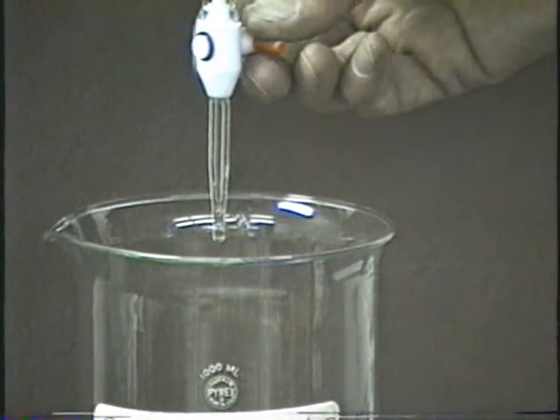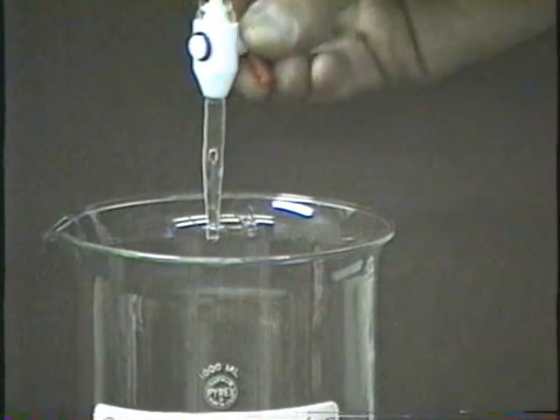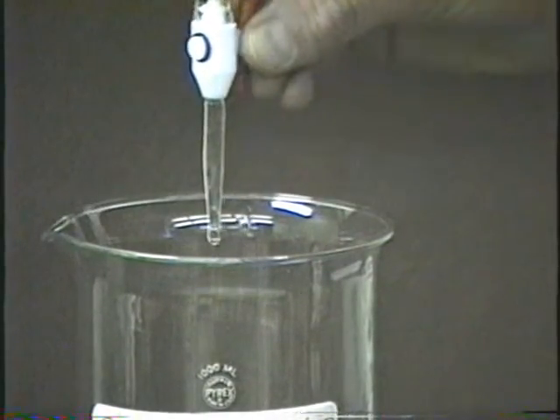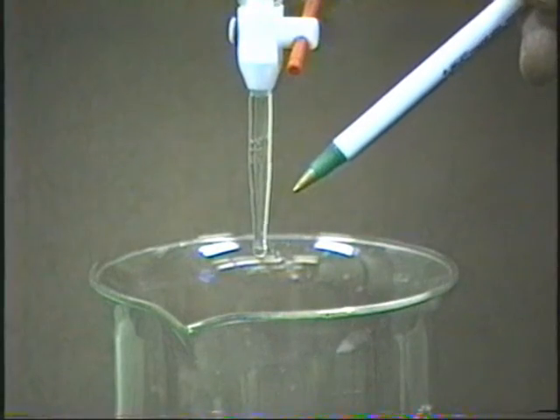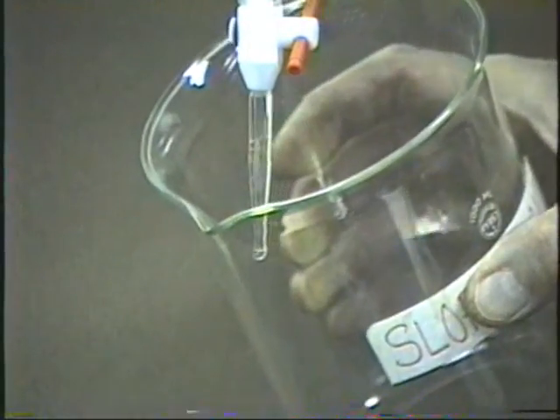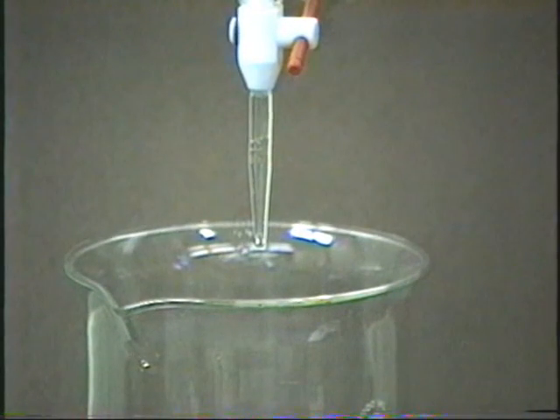All right, here's the tip. Now what you do is just turn this on and off a couple of times. You can see as we're turning it on and off, there are little bubbles coming down, and now that the bubbles are gone, we're all set. We'll touch the tip of this burette to the slop bucket or some other place to get that drop that's hanging off the tip. And now we'll read the 0 mark on the burette.